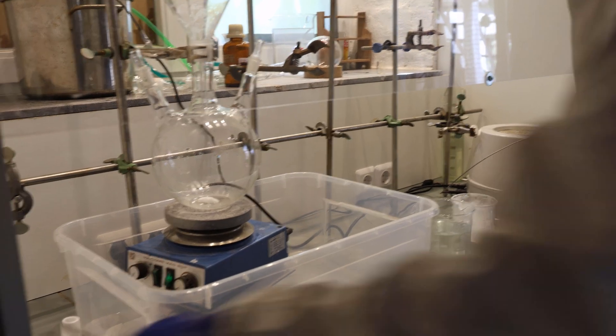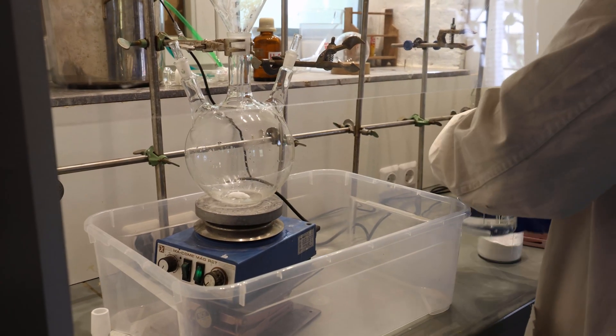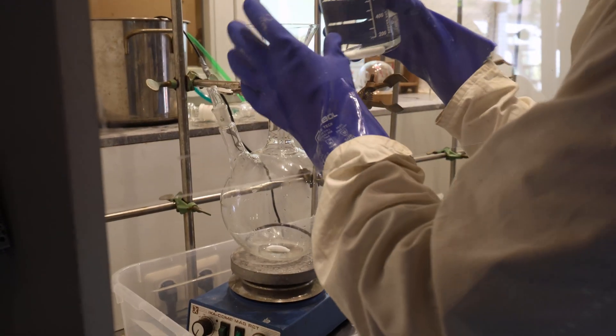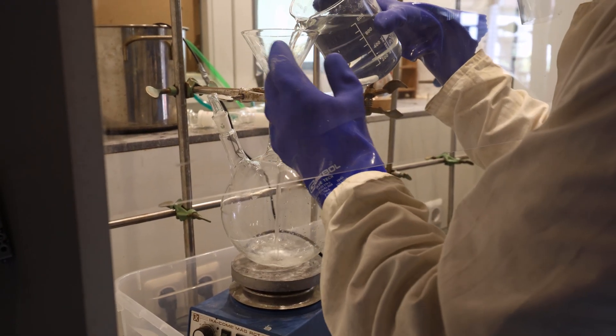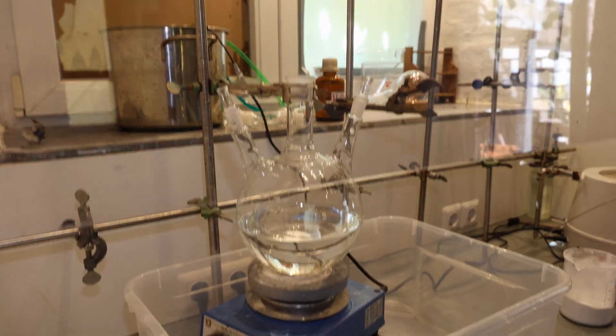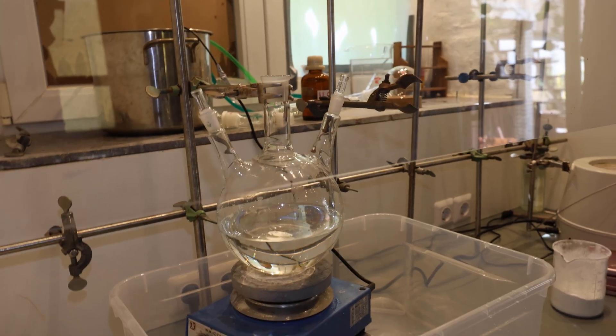Okay so first we're going to put in the sodium bromide solution. Okay the sodium bromide solution is in.